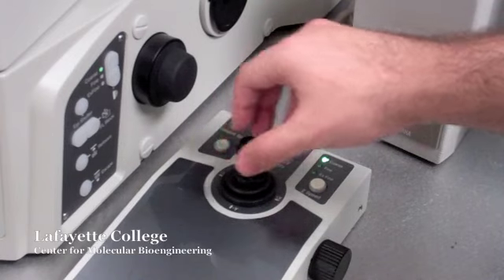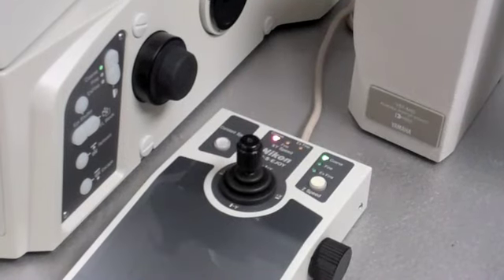The Z focus can also be adjusted from the joystick using the knob on the right hand side.